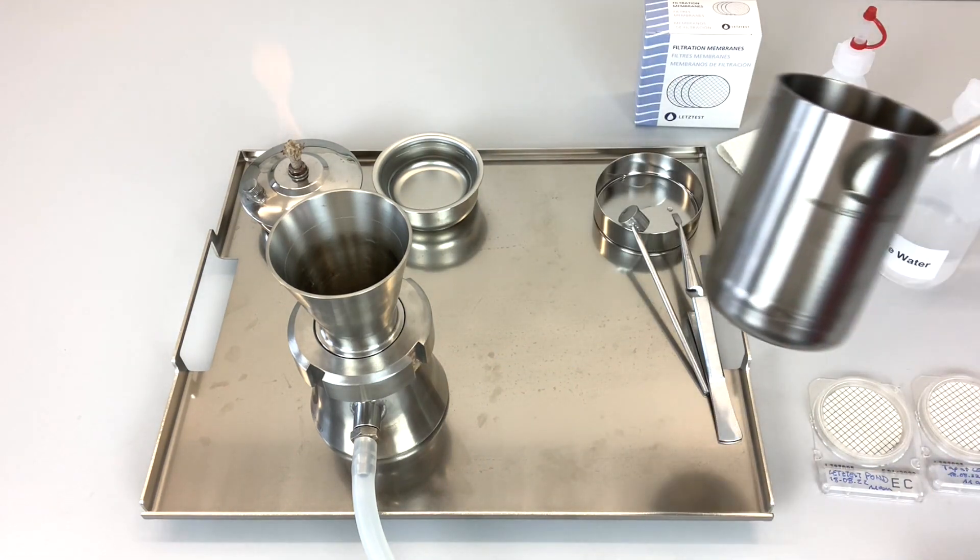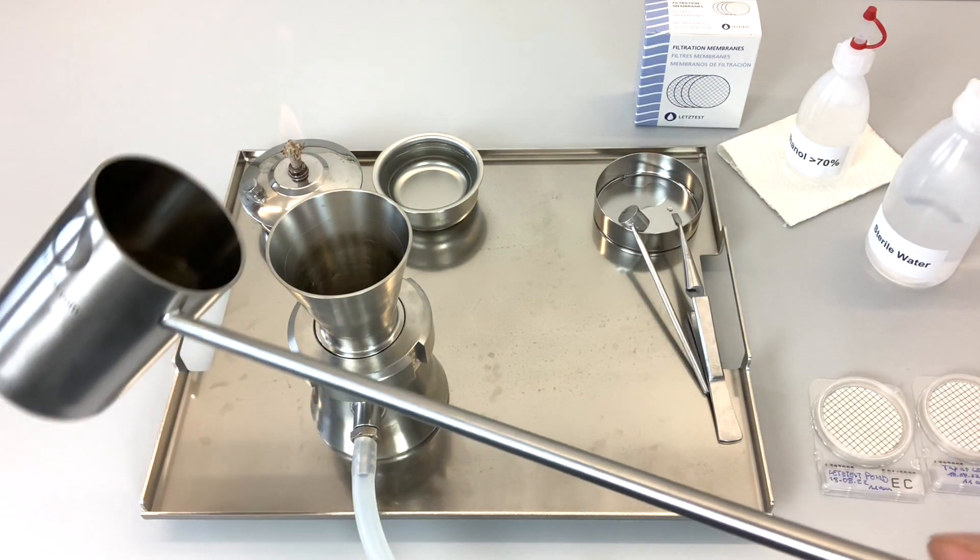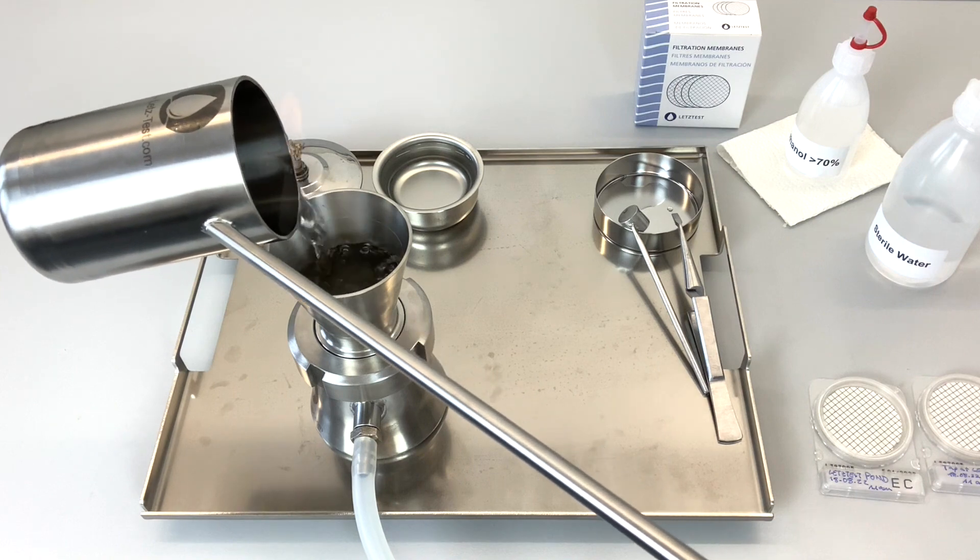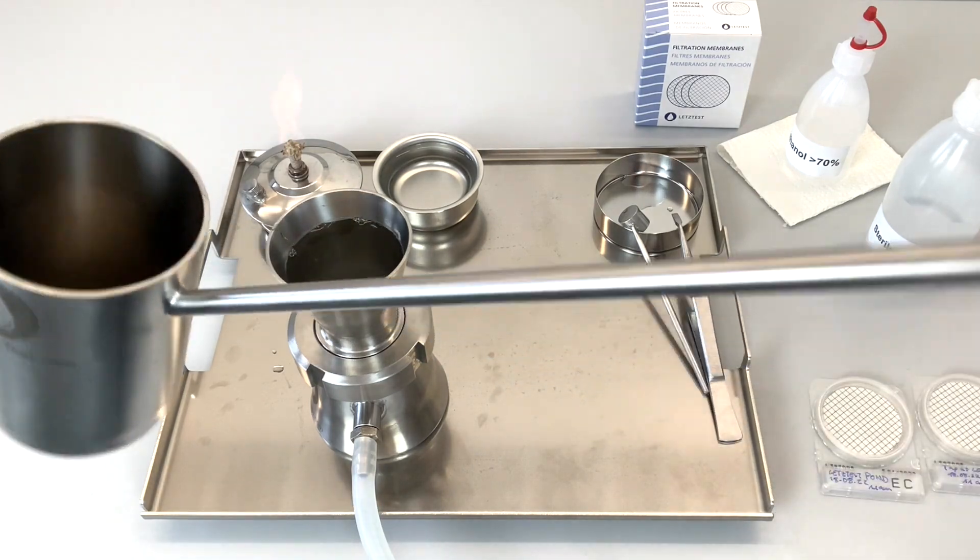Another tip: if the sampling site is next to the testing site, you can transfer your sample from the liquid sampler directly to the membrane filtration unit. This way you save a sampling bag.